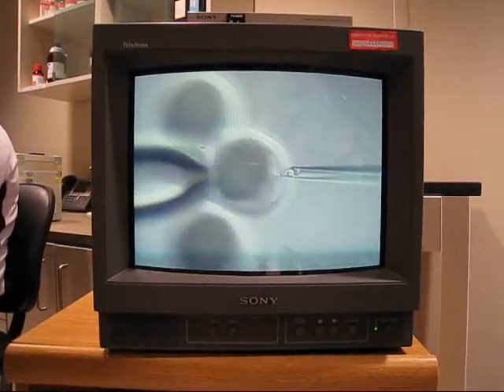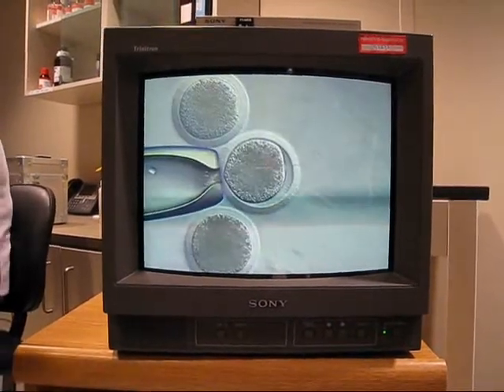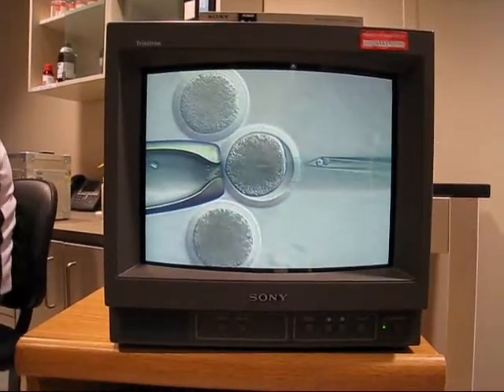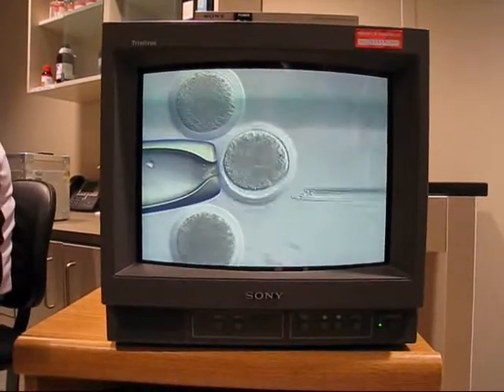Oh, yeah. Oh, gosh. I'm gonna hold that down. There we go. Are you back? Okay, now we got the suction there. That's tough. Okay, now we're trying to. Is it a little clack right here?